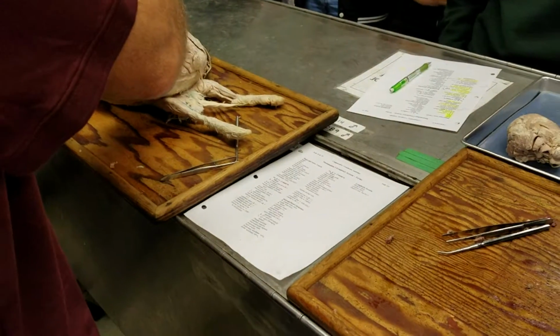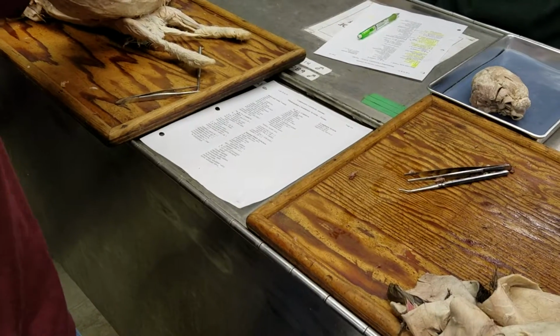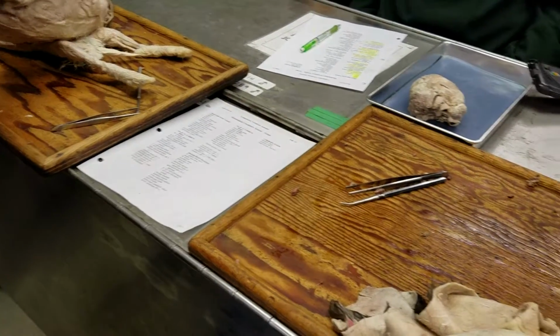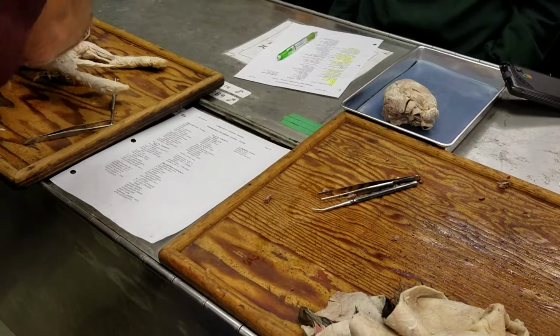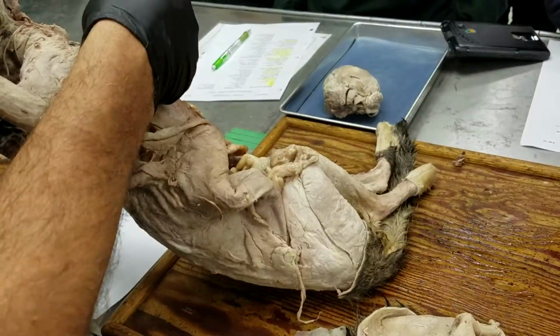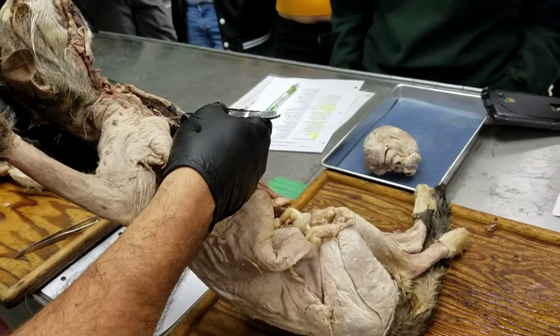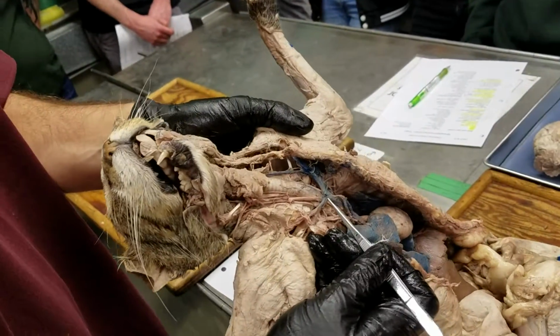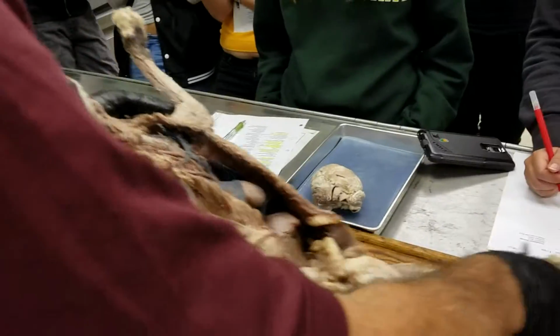And the right brachiocephalic vein here just corresponds to what in the rabbit is still cranial vena cava. It's basically still the anterior cardinal vein. The left brachiocephalic vein is that shunt that develops in the cat across from the left to the right side. Okay. So, for you guys, this left one is that shunt across from the left to the right side, whereas this right one is just the right cranial vena cava. Okay, but they're both called brachiocephalic veins. Yes. Everyone get a good view? All right, cool. That's a little bit strange.